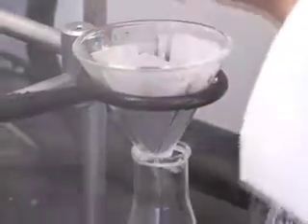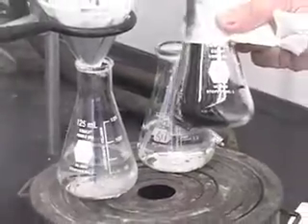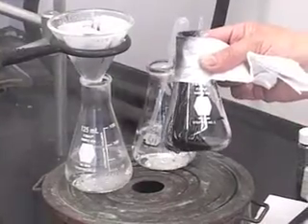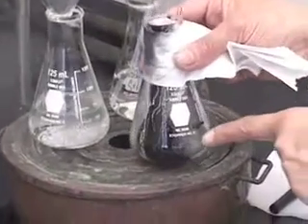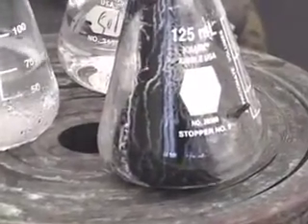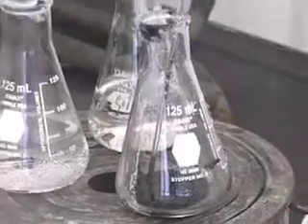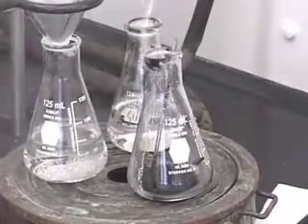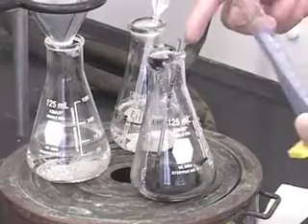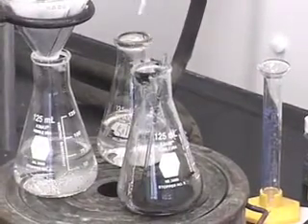So I have transferred all of the liquid. There is some charcoal left here, and there is some more charcoal on the filter paper. But we really, as I said, want to ensure that we recover as much of the compound as possible. So I'm going to rinse this with some hot solvent. You can rinse it with 2 portions of 5 ml of hot solvent. Again, this 5 milliliters is approximate. So if you want to use a graduated cylinder to take 5 milliliters and pour, that is okay. But I'm just going to do an eye estimation here.